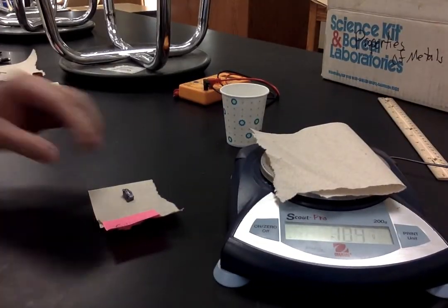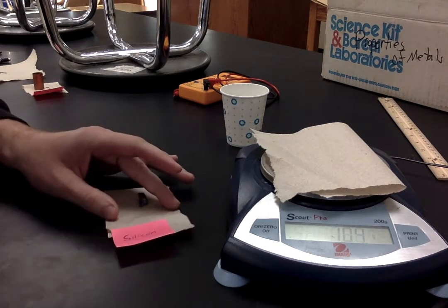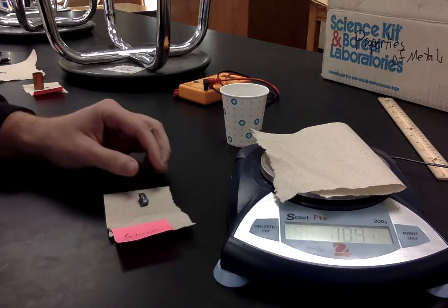So what we have here is a scale, and then we've got some silicon right here. I don't know if you can read that or not, but it's labeled silicon.